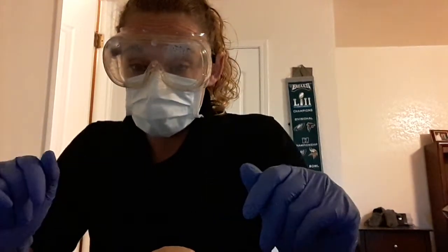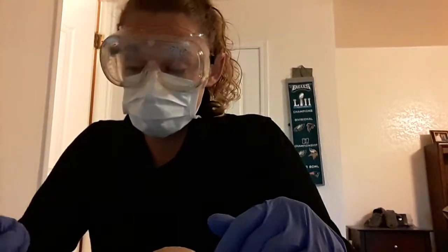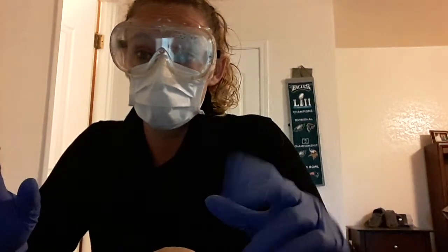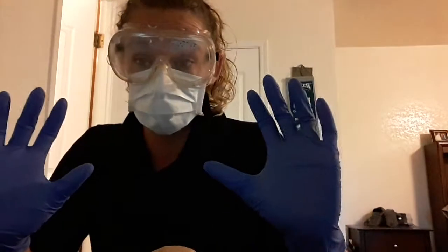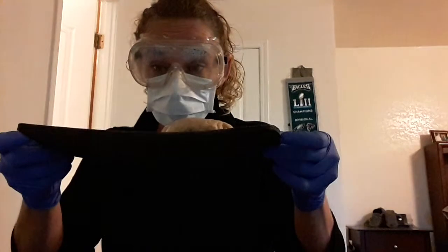This is my Week 7 Anatomy Physiology class video. For this week, we had to do the gross anatomy of the central nervous system. And for this video, we needed to have gloves, mask, goggles. I have my cutting board here.